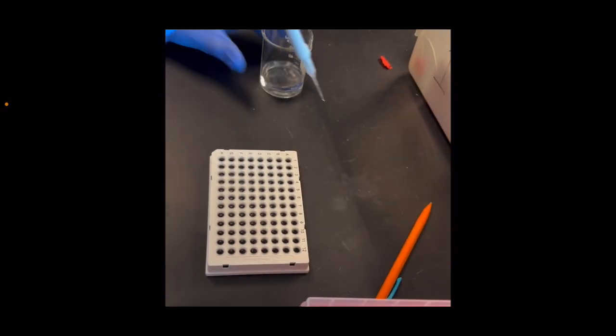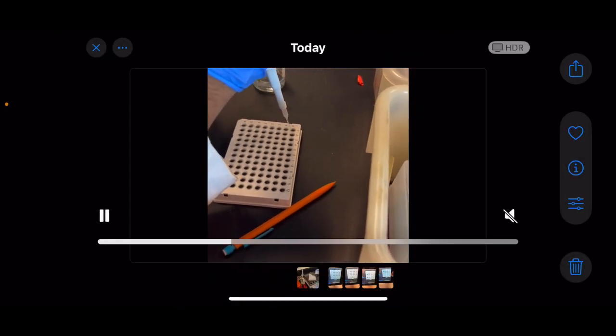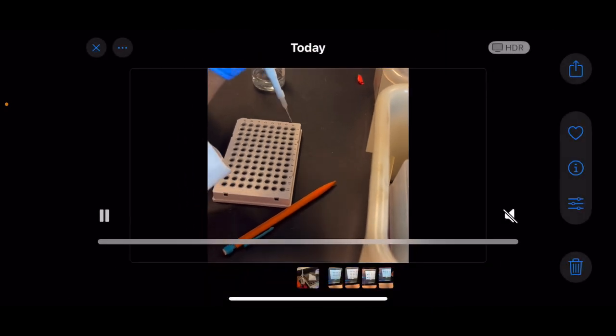Now I'm adding 9 microliters of DI water into wells A1 through A6, and after that, 5 microliters of DI water to wells B1 to B6. This is the water that will be used to dilute the BSA. The Opentrons will add 1 microliter of BSA into the first 5 wells, and it will add 5 microliters of BSA into the first 5 wells of the B column. I will add 1 microliter myself to A6 and 5 microliters myself to B6 to test as a control.